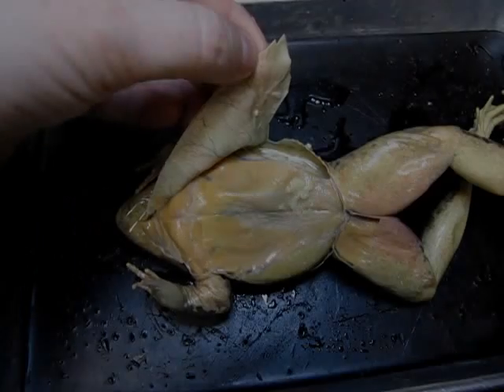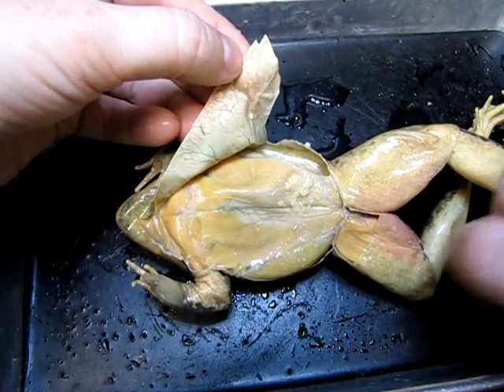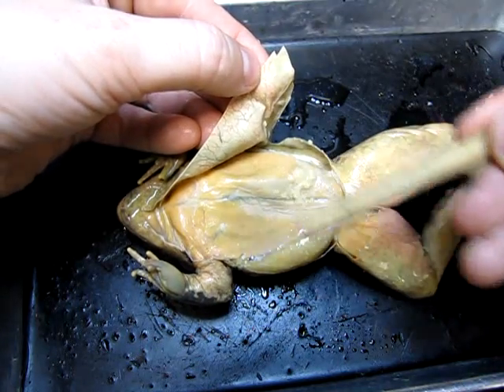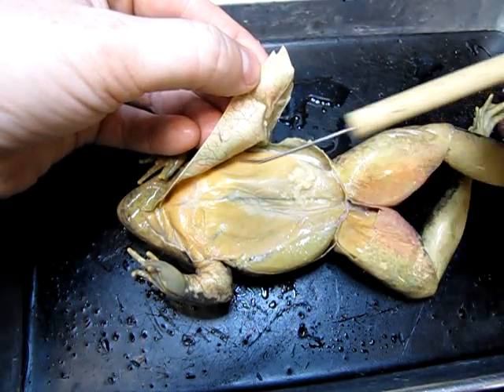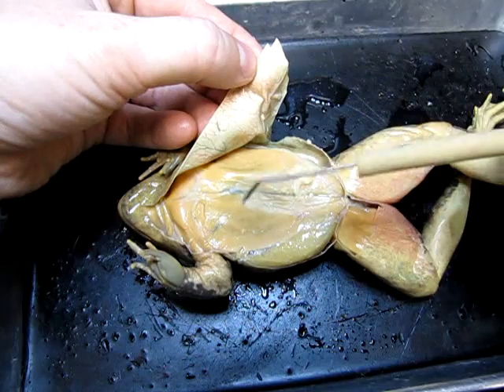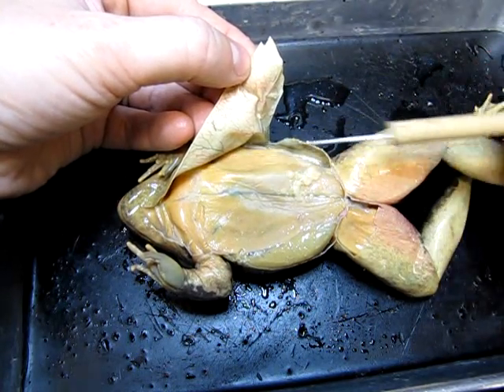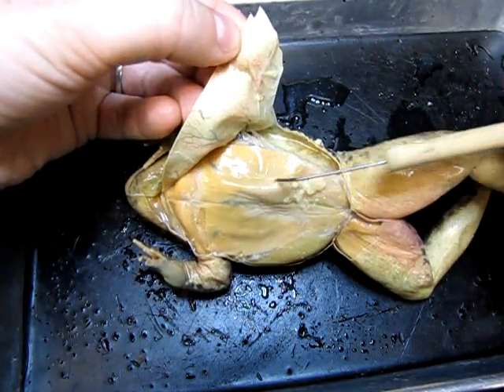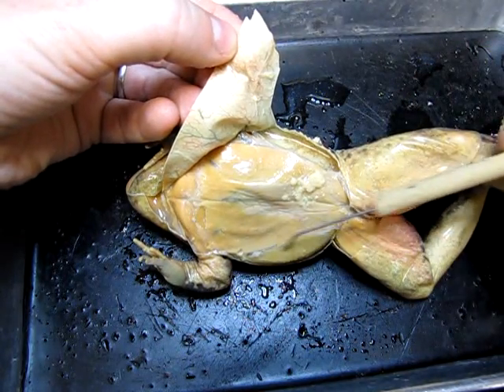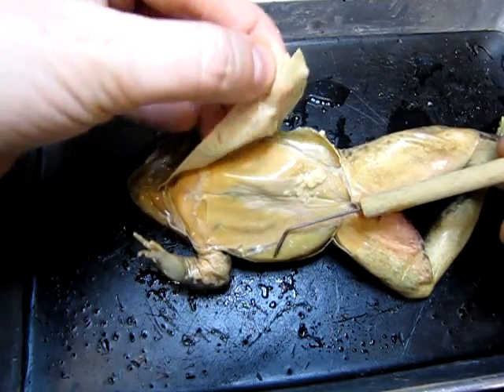I have begun the dissection on this frog. You can see that I've removed the skin just from the ventral surface here. All of this beige-ish tissue is in fact muscle tissue. I just wanted to show you the extent of the tissue along this abdominal wall.